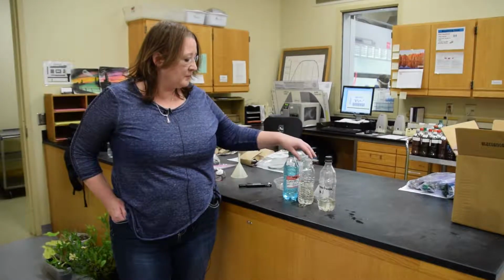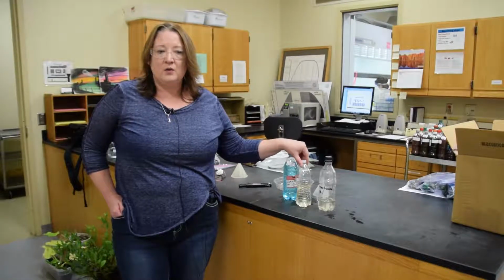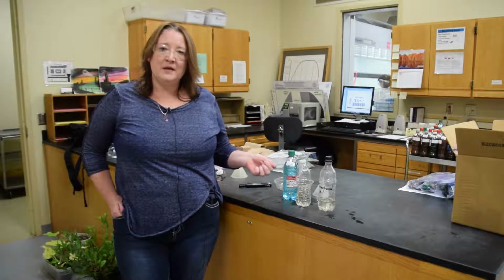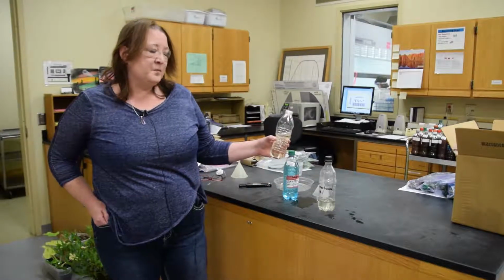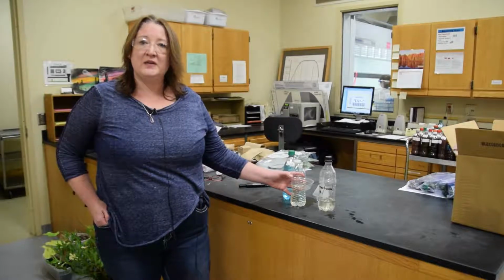We recommend for any grower that they at least annually submit an irrigation water sample. For an irrigation water sample, what you would do is turn on the tap or the emitter and allow it to run for a few minutes in order to clear out the lines. And then you'll fill a plastic water bottle 3/4 of the way to the top for that sample.